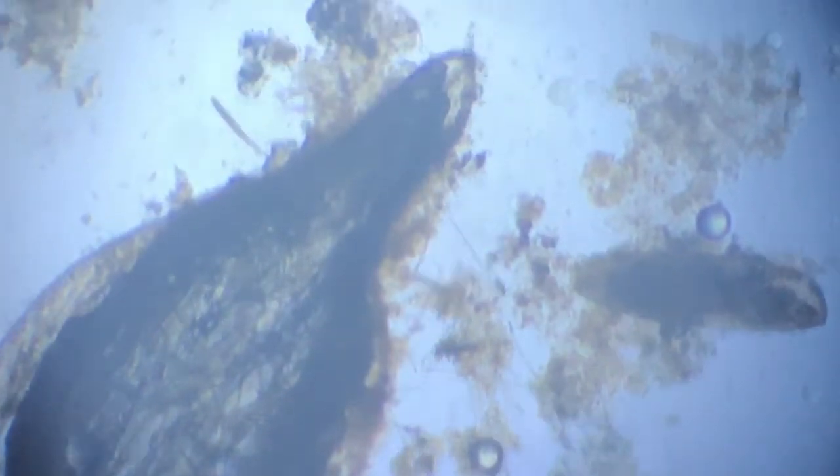This is the other wing, and now this is the other wing. Now I think you can make out, and this is the abdominal part of the body. Even this has a lot of activity going on. A lot of microbes are in there also.